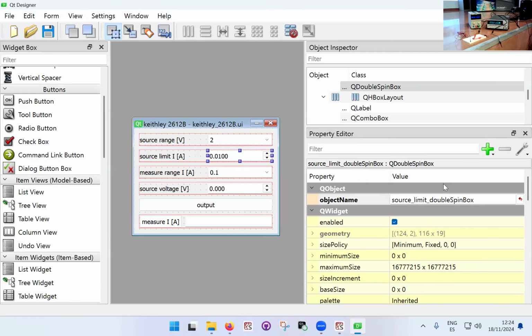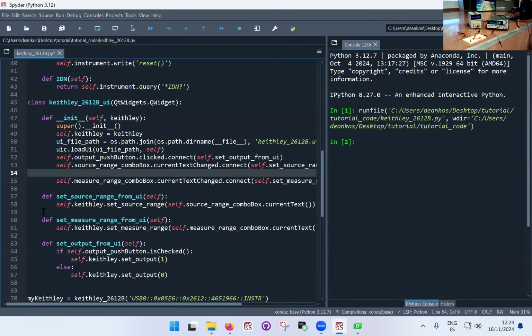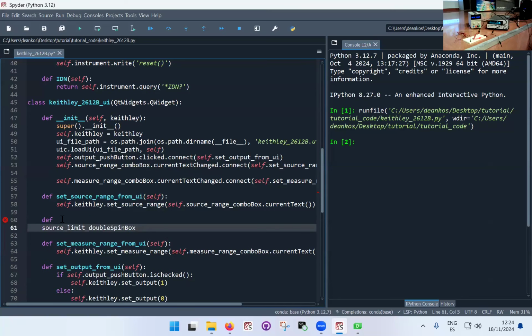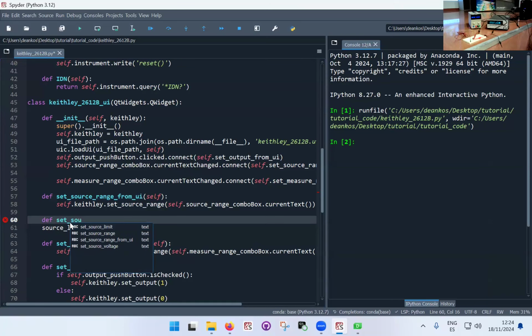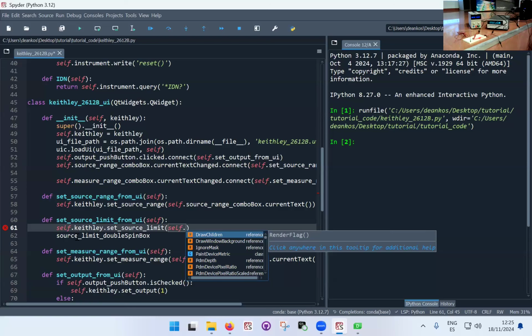And then we have the source limit. Okay, so this we need to actually implement separately because it's not a combo box, so I can't reuse the same function. But let's see. So I'm going to put a new function here. I'm just going to use this set source limit from UI. To set the source limit from UI, I have to go for self.keithley dot set source limit. There we go. And the value should be the self dot source limit spin box.